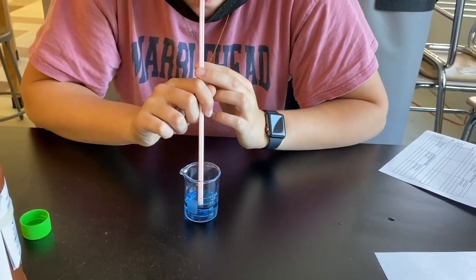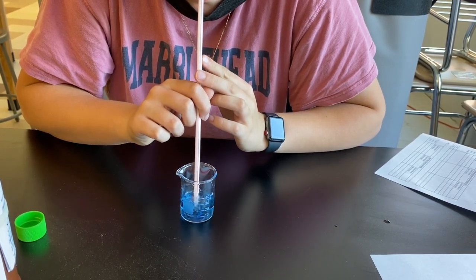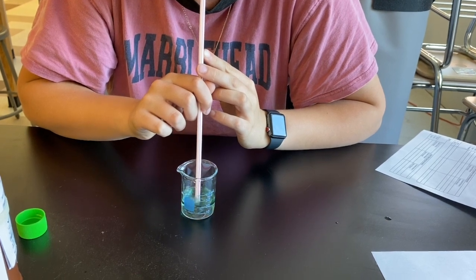Have a group member measure the amount of times it takes for the blue solution to turn yellow. As you blow, watch the solution turn from blue to yellow.